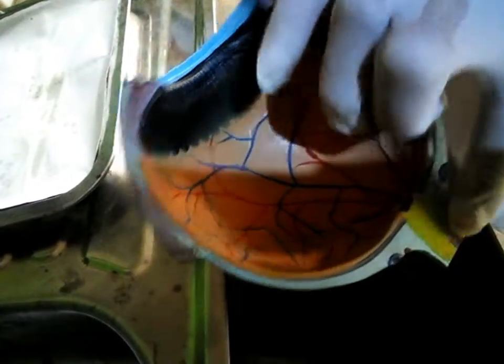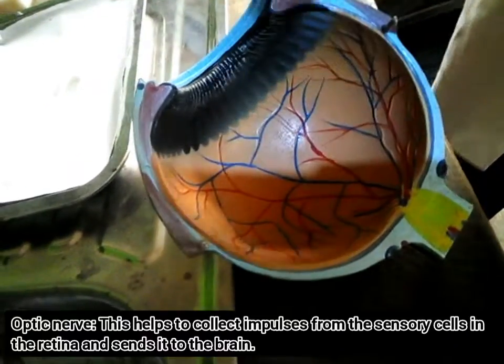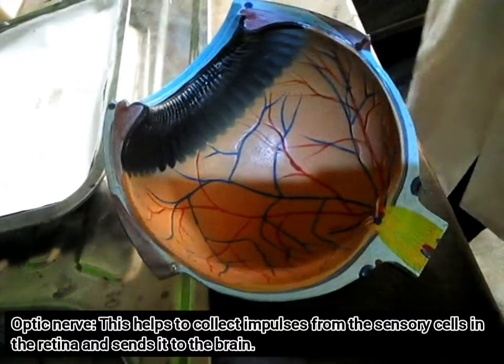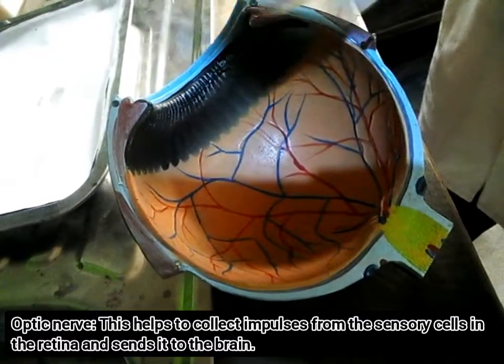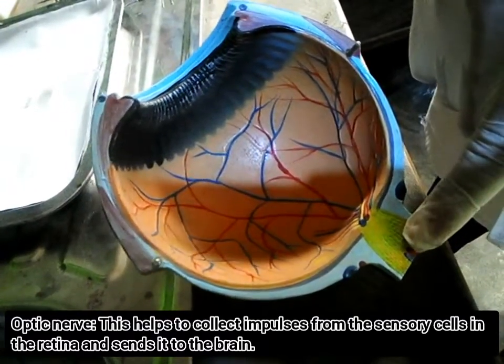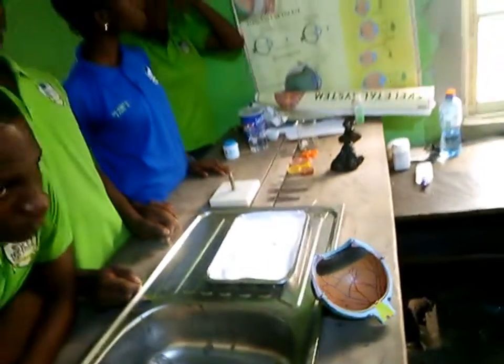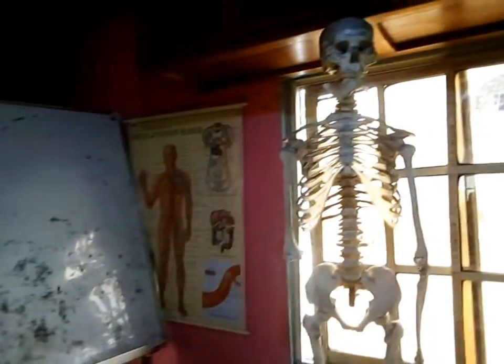With the help of this optic nerve, it collects impulses from those sensory cells and takes them to the brain. So this optic nerve is found around this area, and it goes to the brain. Do you understand? So that is that.